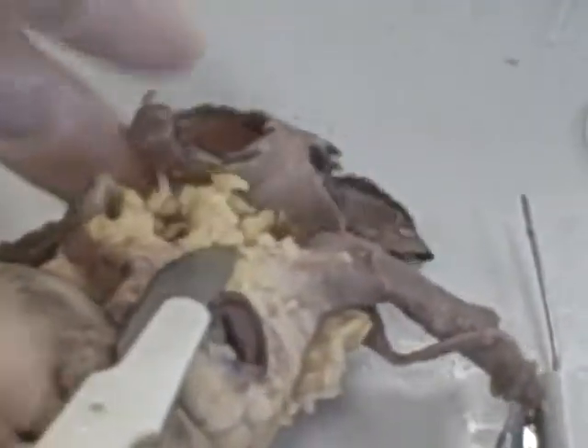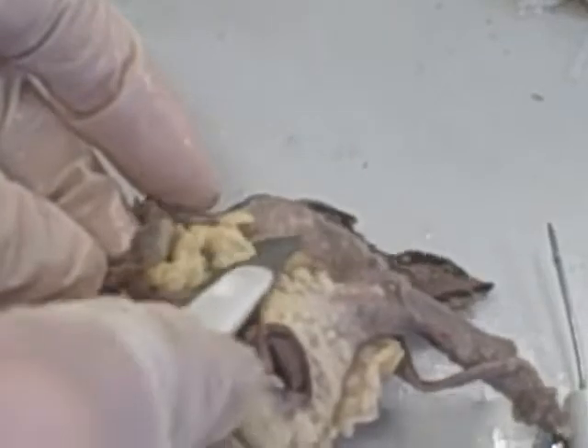These are the auricles here. And there's also a lot of yellow fat around the sheep heart. You can tell that it had fat around the heart — it may have been the cause of death.